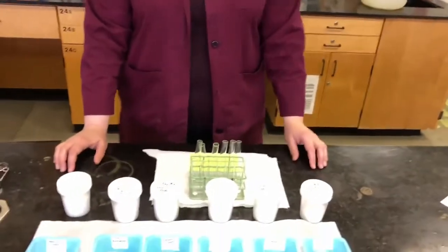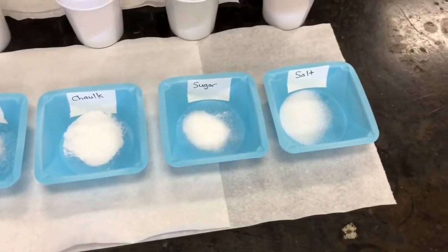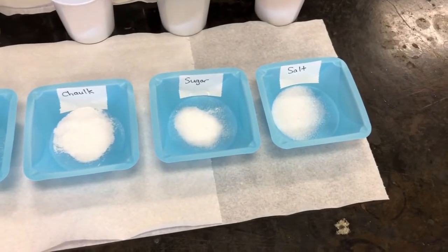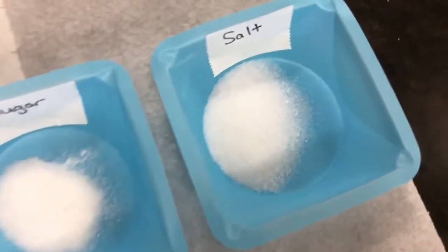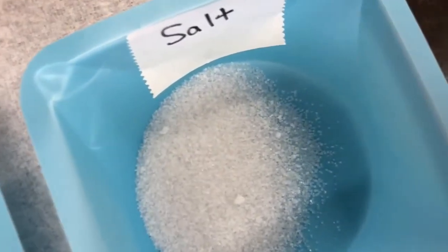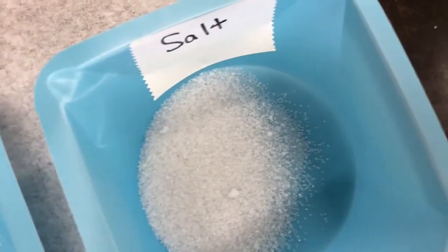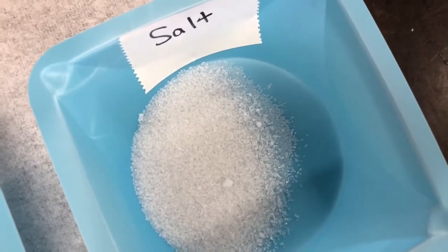The substances that we're using here today, we're going to start by looking at their physical properties. So we're going to start with salt. This is just common table salt, the same salt you would use at home. We're going to start by looking at the color and the particle type. For color, we're looking at whether it's white or whether it's colorless. If you just look at a tablespoon of salt, which is about what we have here, if you look at it as a group, it looks like it's probably white.